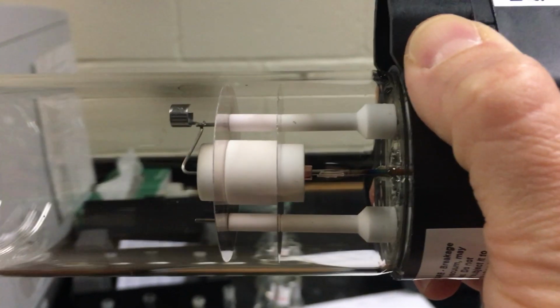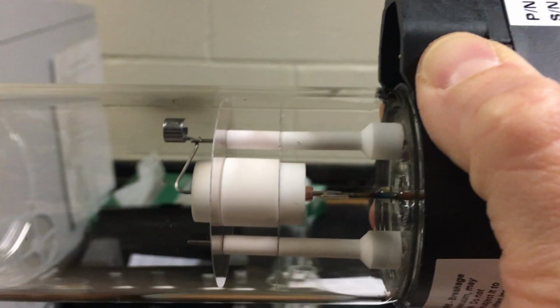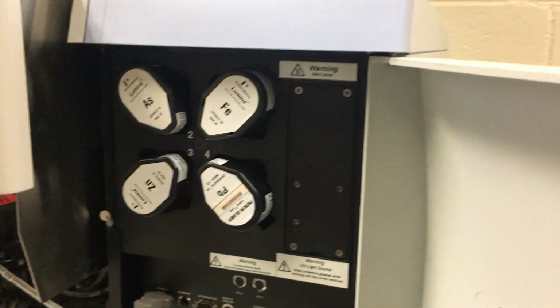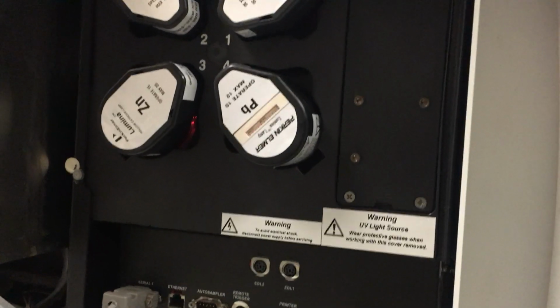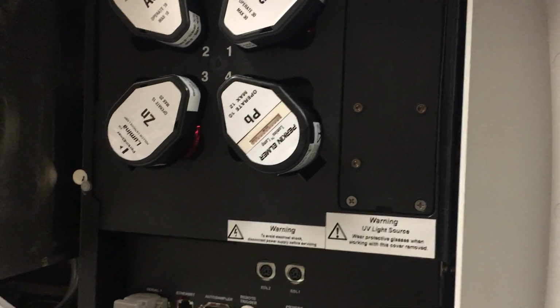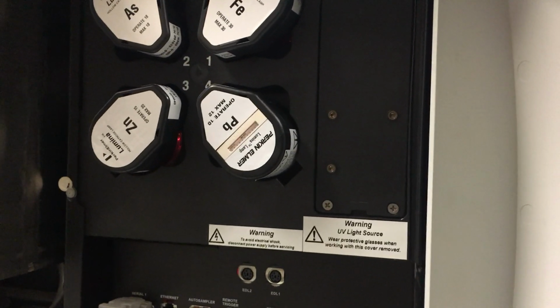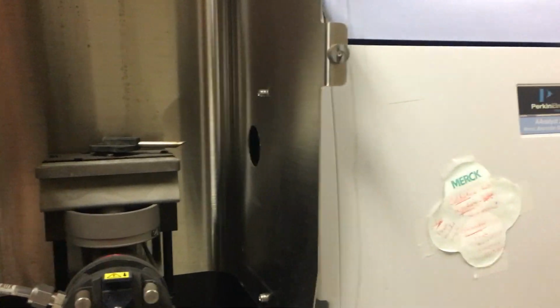That impact causes the metal of interest, or the cathode, to eject electrons, or rather photons, that are characteristic to that particular element. And so today, if we take a look inside here, we'll see that our zinc lamp is undergoing that process, which is called sputtering. Around that zinc lamp, you can see that there's a nice pinkish purple color. That color is the result of sputtering, and thus we see that there's a beam of light that's generated that is characteristic to zinc. Those specific wavelengths that are being emitted are characteristic to our zinc element.